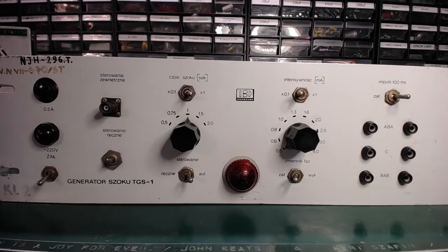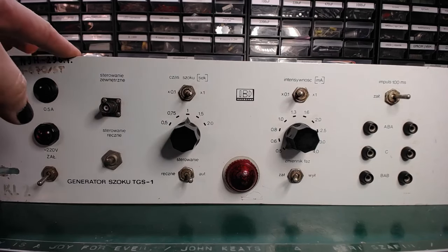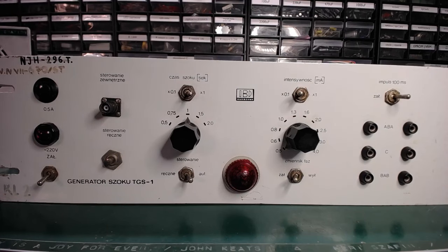This device was made in the 1970s in Poland. It was made for the Institute of Experimental Biology of the Polish Academy of Science in Warsaw. And what it does, it applies voltage across the rods on a Skinner box floor, shocking the animal inside, like a rat or a pigeon.